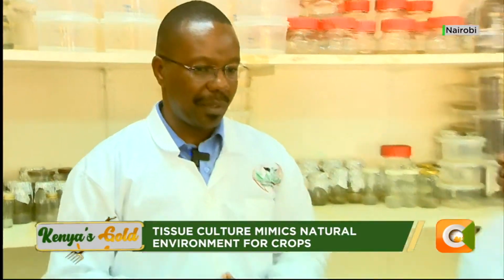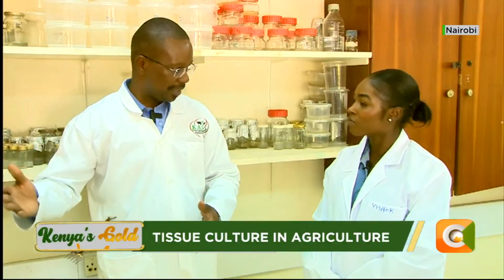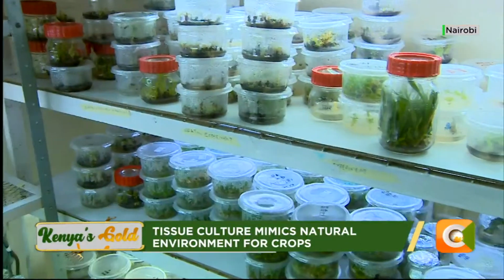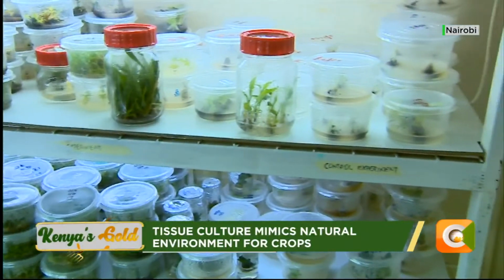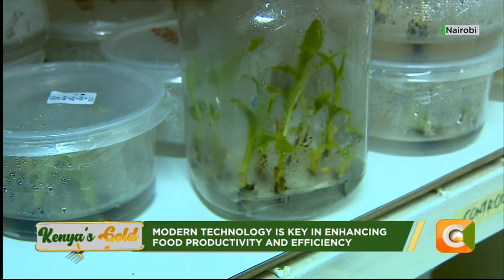Secondly, we are able to give a good number of materials to the farmers. Remember, when we are doing propagation with cuttings, there is a limit. Let's say you want to plant 100 acres or 200, you can imagine the number of cuttings you will need. So this technology helps you generate small plantlets, which you can move with speed and have enough planting material.